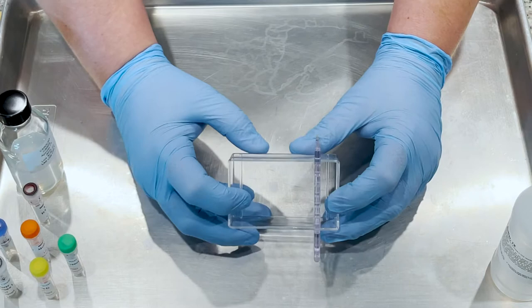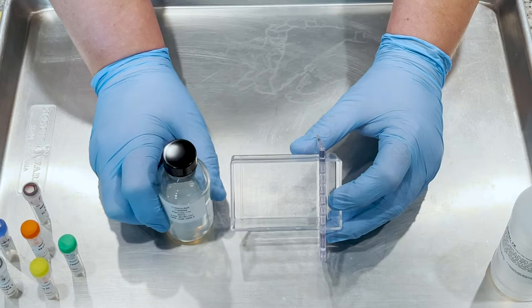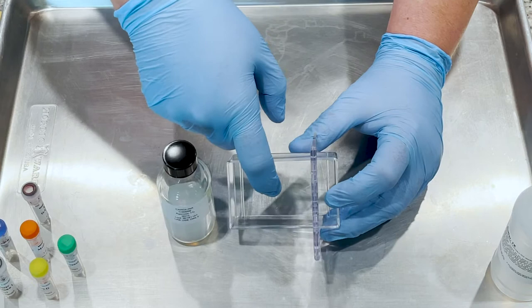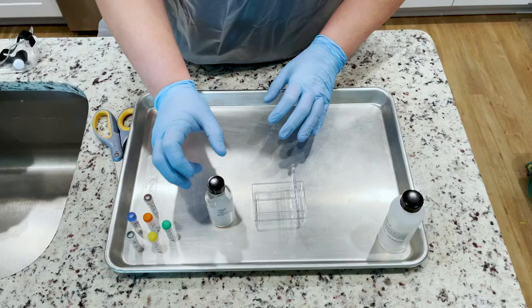Notice how the comb is all the way clicked in place. Then notice that inside the gel box there are these ridges. We are going to be melting the agarose and pouring it into the gel box. We want the agarose to go into the area between the ridges but not the area outside the ridges. There are these little wells outside the ridges, so the agarose needs to go in the middle between the ridges but not on the outside.